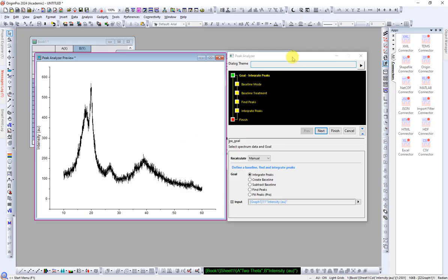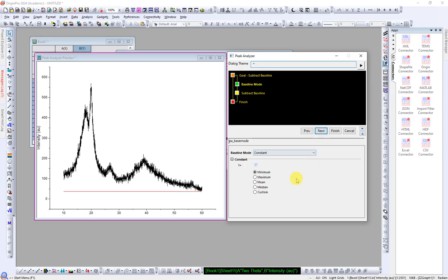Okay, now we have to click on Subtract Baseline. We are going to set this baseline, and make sure you have chosen the graph which you want to set. I have chosen graph 1. Here it was also graph 1 as I have only one graph. Then click on Next. Okay, so there are different ways. One is constant, and it will just bring it here to the red line, but sometimes it doesn't fit very well or doesn't subtract very well.